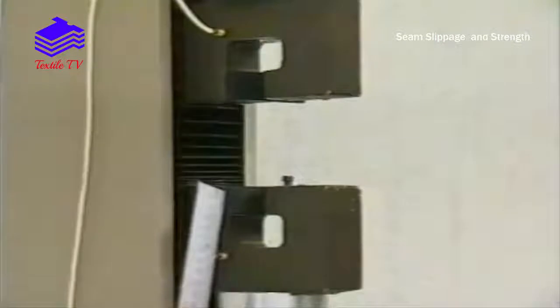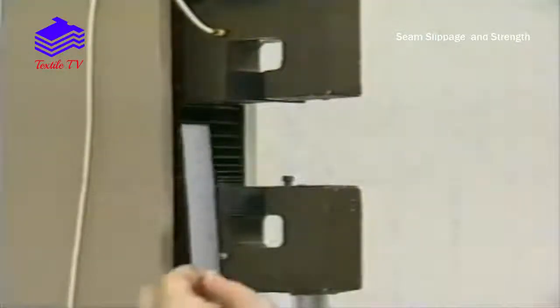The gauge length distance between top and bottom jaws is set to the specified distance.